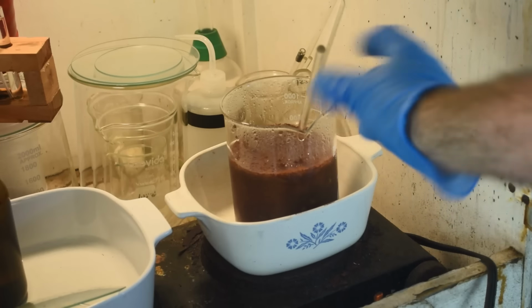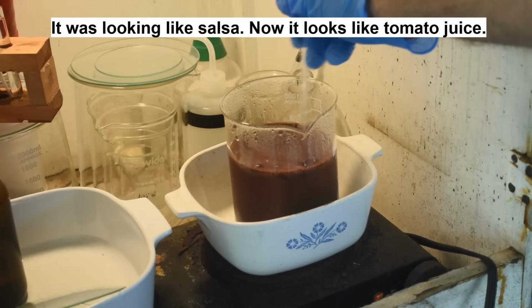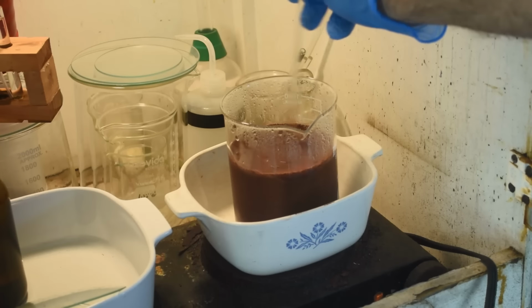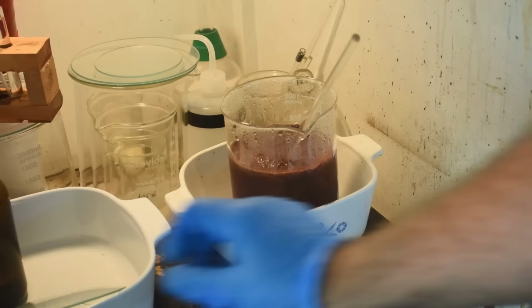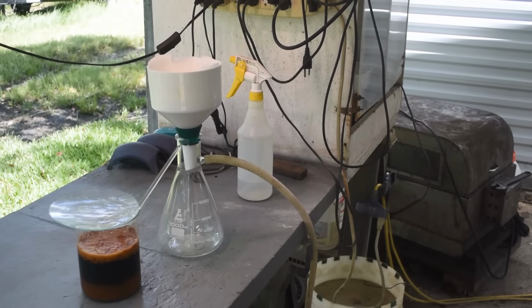All right, this stuff was looking a little chunky as it's warming up here, so I added another couple hundred milliliters of water to it just to make sure there's enough liquid there, hopefully to dissolve everything. I don't want to leave solids that stay behind on my filter. So, yeah, that red stuff. I know there's a lot of paper pulp there, though. A lot of those solids may just be paper pulp.